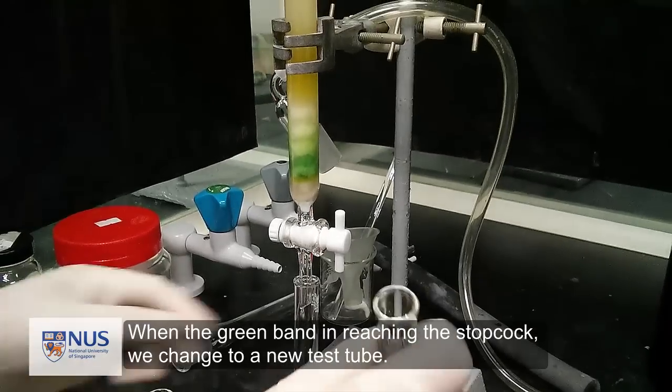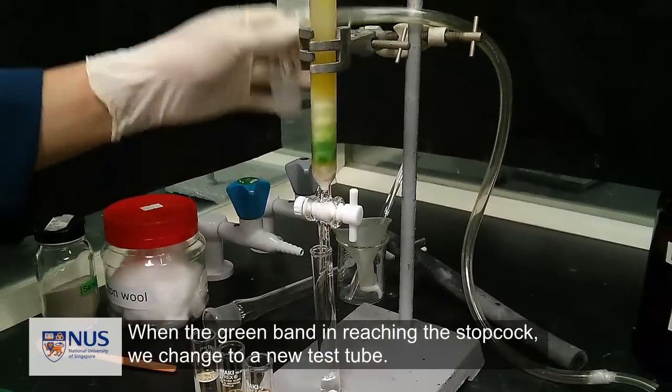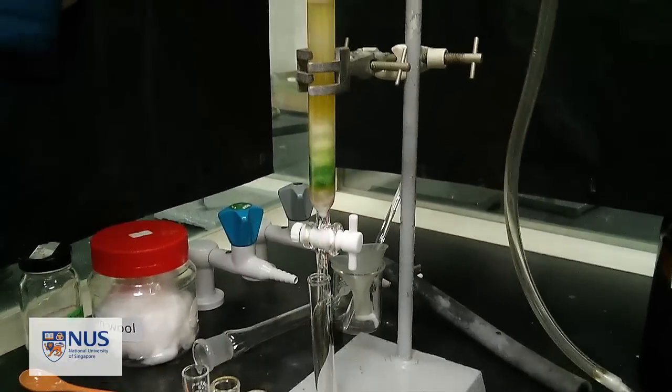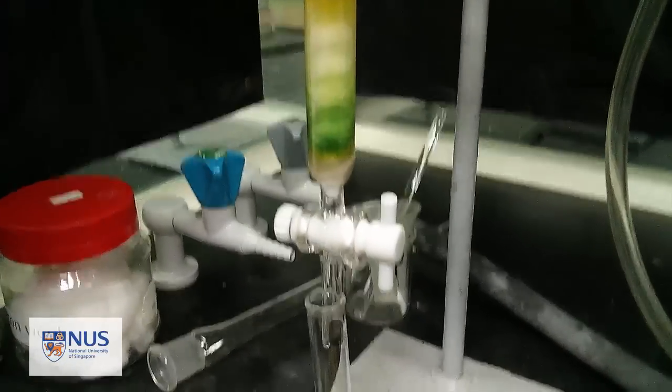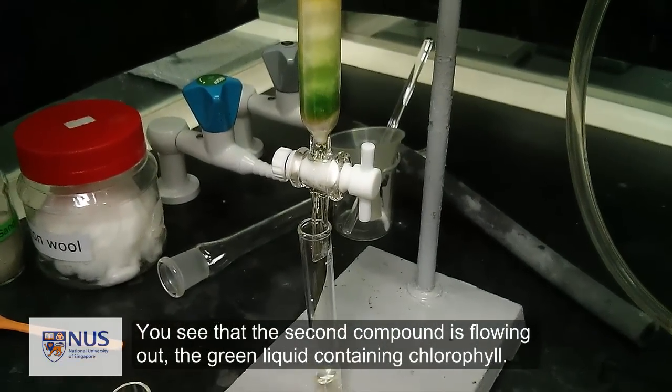When the green band is reaching the stopcock, we change the new test tube. You see that the second compound is flowing out, the green liquid containing chlorophyll.